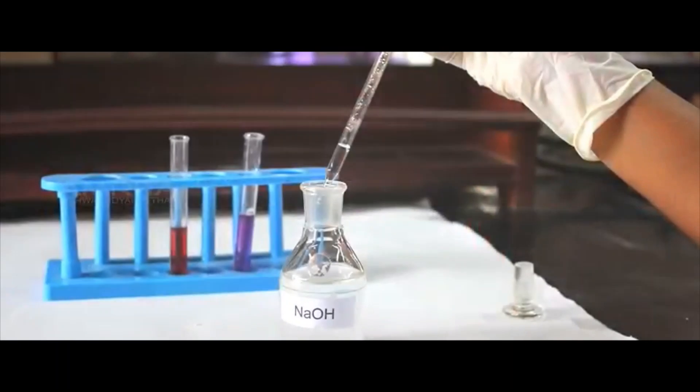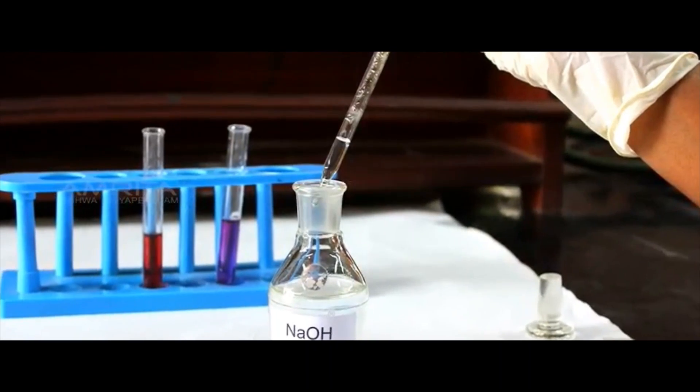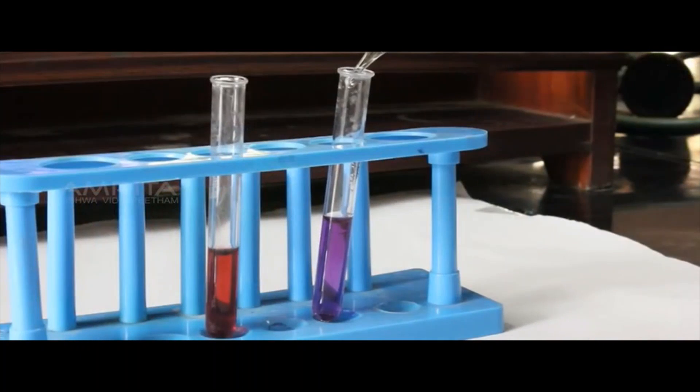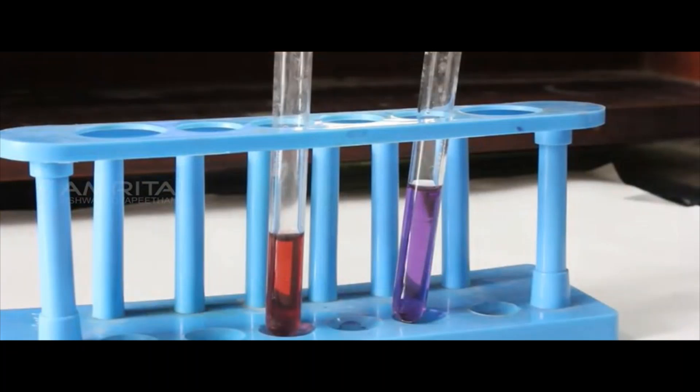Similarly, add a few drops of NaOH to red litmus solution and blue litmus solution which are taken separately in two other test tubes.